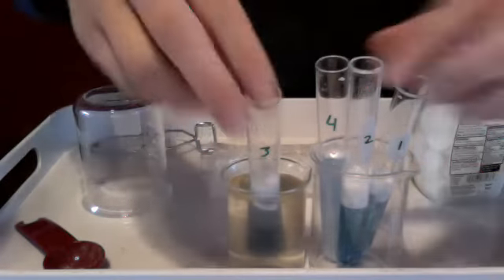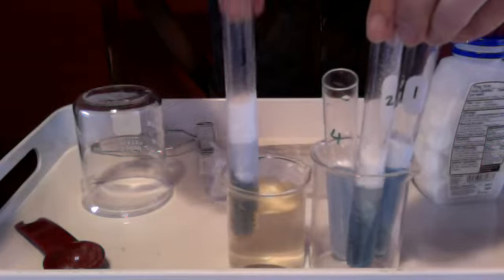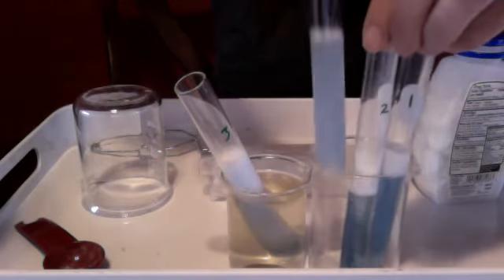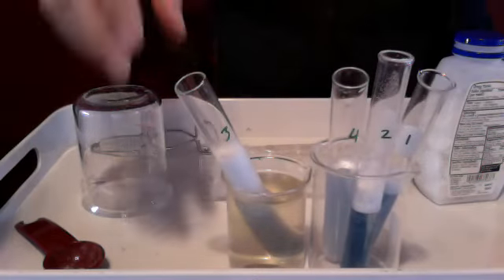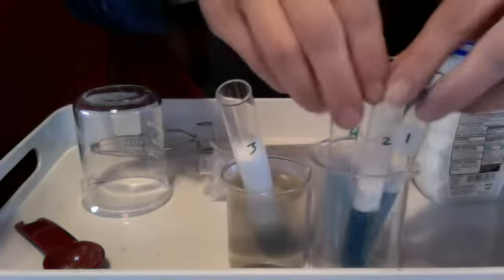Okay, so the way you're going to judge this reaction is by the foam. Here's our foam. Here's 3, which is in the hot temperature there. Here's 4. This is the diluted one. It's doing little to nothing. Hopefully you all assumed that would happen. You can see number 3 has really taken off. The temperature is doing a large amount there.